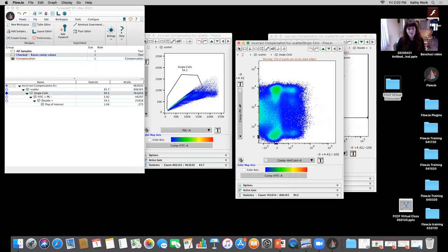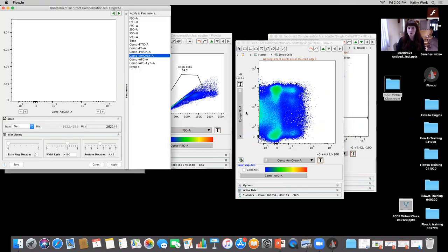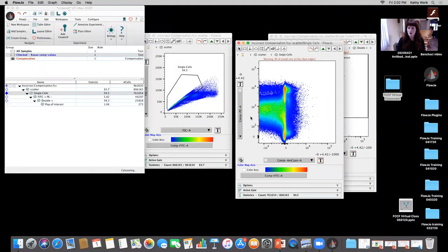And what you can see is we have a lot of extreme negatives. Okay, that should always be a red flag for you. So if I come in and adjust this transform, and adjust that width basis, I see extreme negatives here. That's always indicative to me of inappropriate compensation, that something went wrong. Okay, so whenever I see that, that's a red flag.